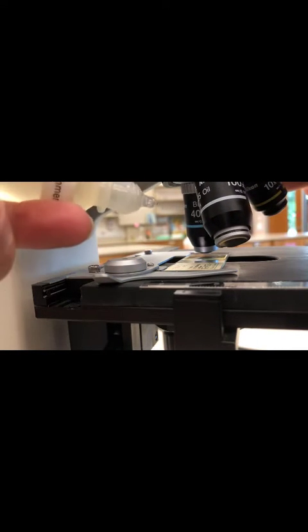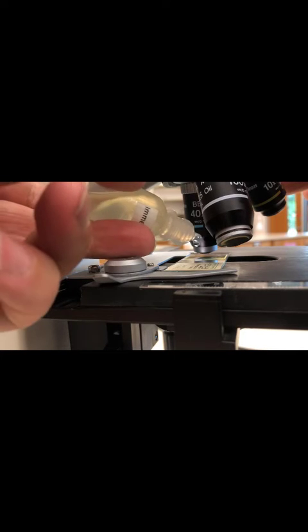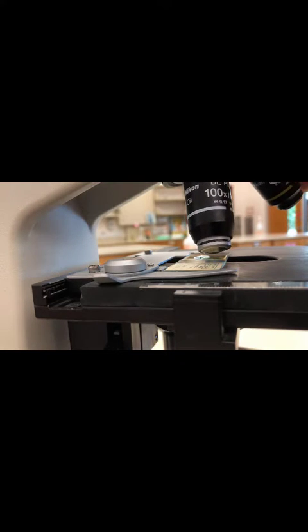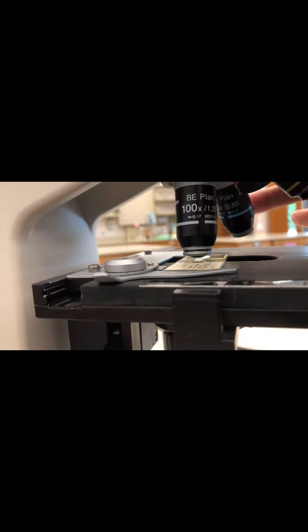You're going to go past the 40, place one drop of this oil directly on the slide, and then you're going to engage the 100x objective. You could go a little bit past the slide and then back.